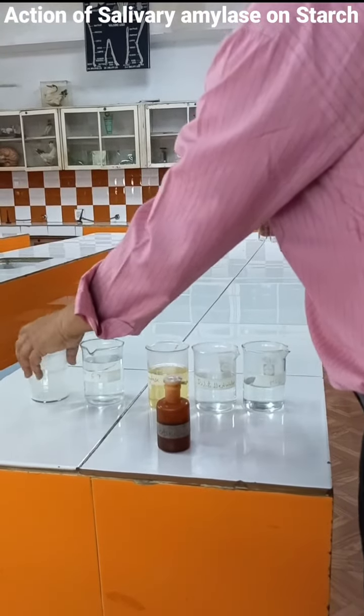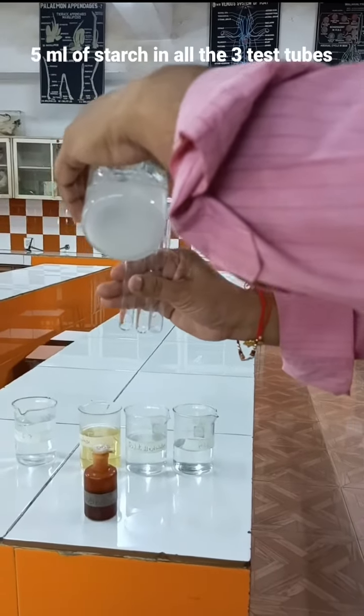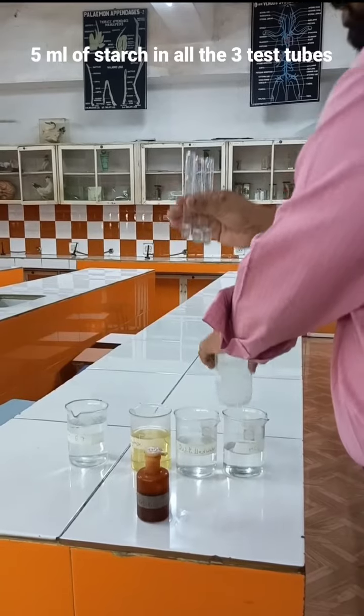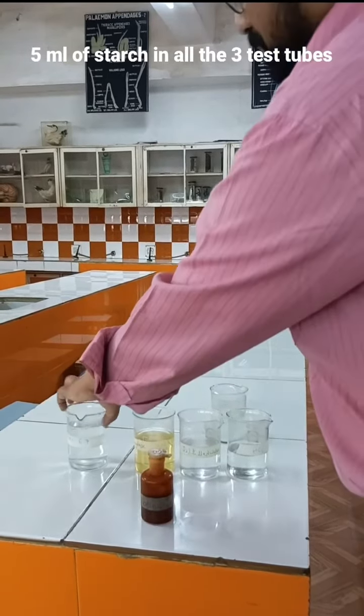Action of salivary amylase on starch. So first of all, take 5 ml of starch in 3 test tubes. Label the test tubes as test tube number 1, 2 and 3. So I've taken 5 ml of starch in all the 3 test tubes.